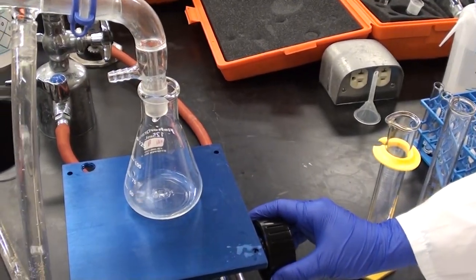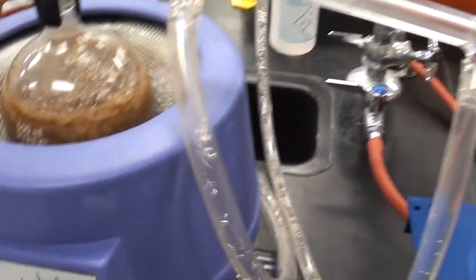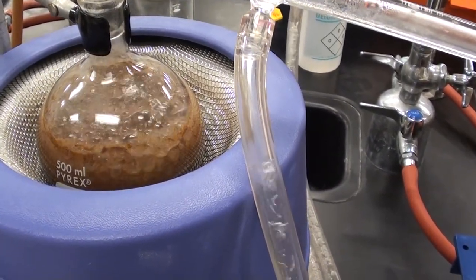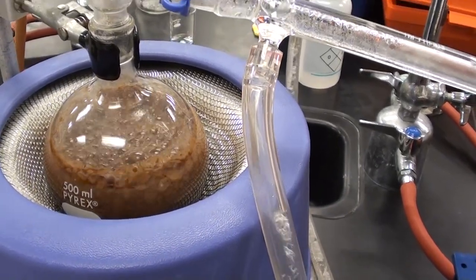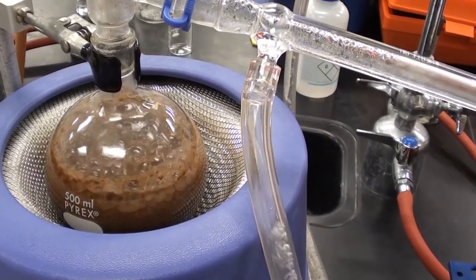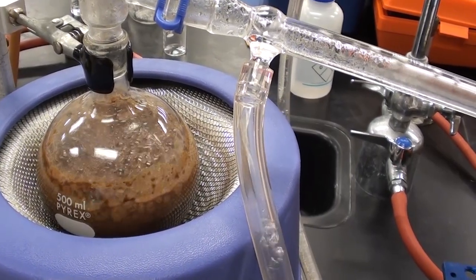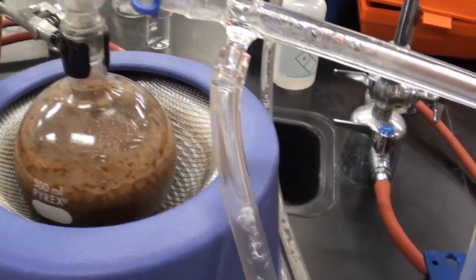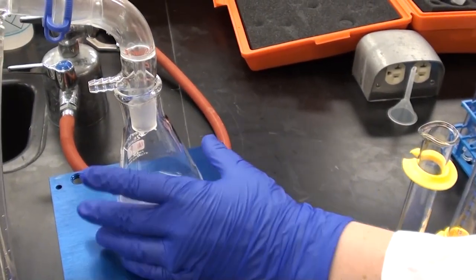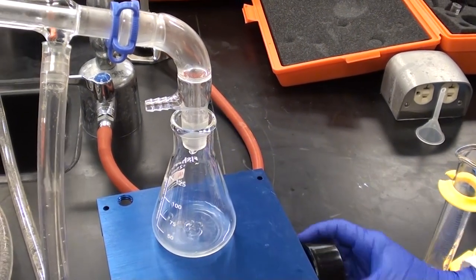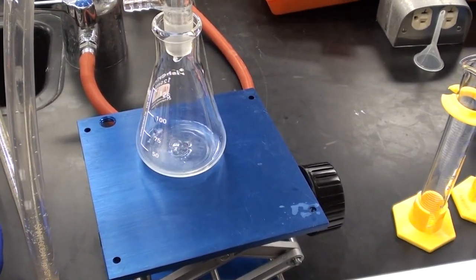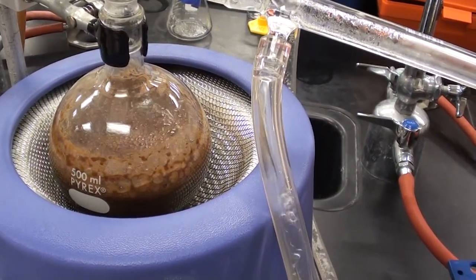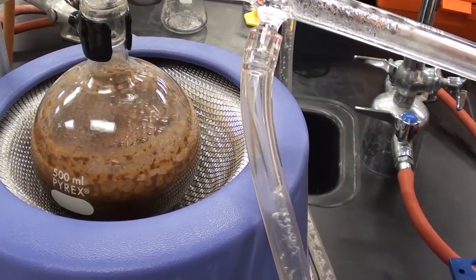You can see here we've got stuff coming over, which is great. Now take a look at that. See how it's beginning to foam up a little bit? So we're going to lower that a little bit now because it's not really behaving itself. This is the game you're going to have to play with it. But if we lower it, that will stop the foaming as well. You can see here where we are collecting stuff, which is good. You see it's kind of oily, an oily liquid that we're collecting here.